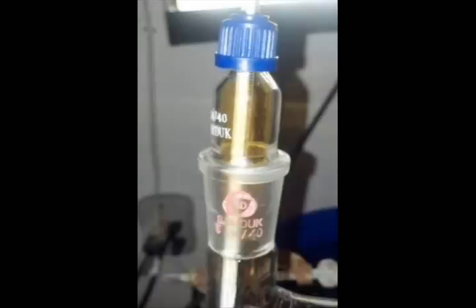After the foaming calmed down, I swapped the apparatus for clean glass and watched the temperature. Once the temperature reached 121 degrees and I noticed nitrogen dioxide gas in the apparatus, I put a clean beaker under the condenser and began to collect the acid.